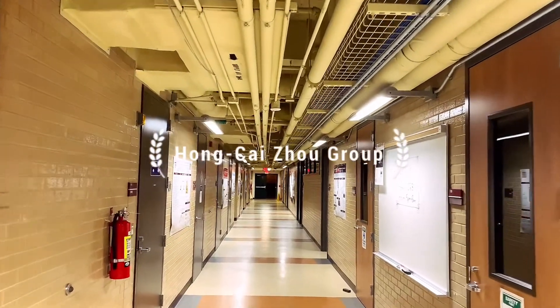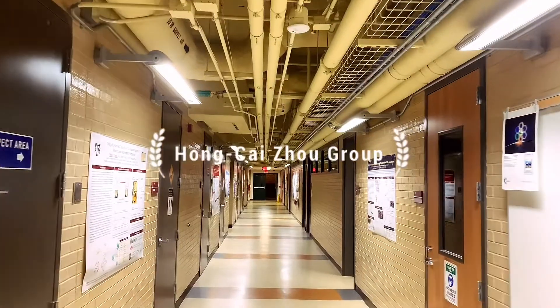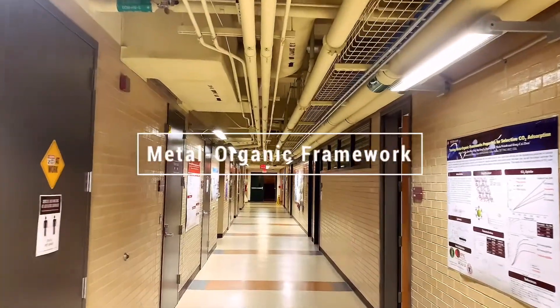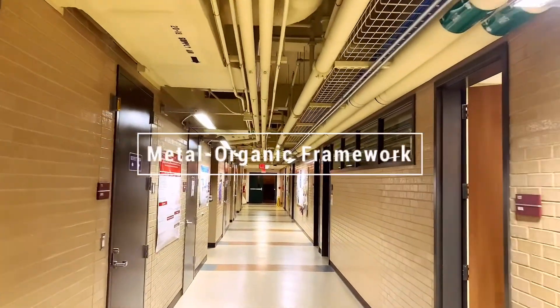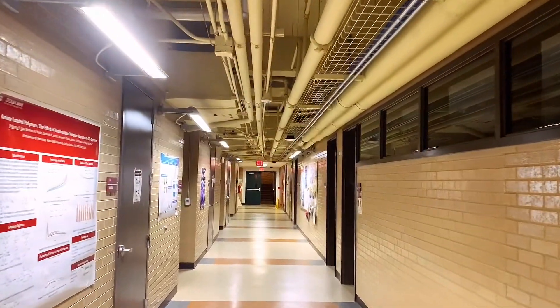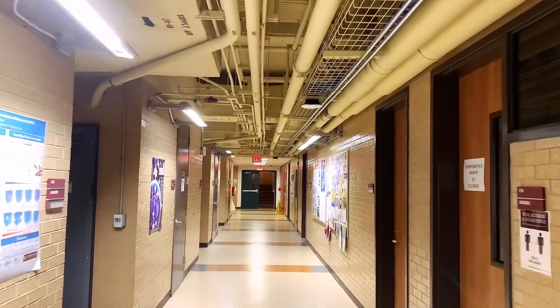Welcome to Texas A&M University. We are a group of Dr. Hongcai Zhou. Our group focuses on synthesizing metal-organic frameworks, a novel porous material which has wide applications such as catalysis and gas storage and separation.